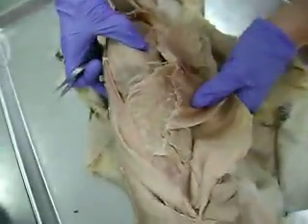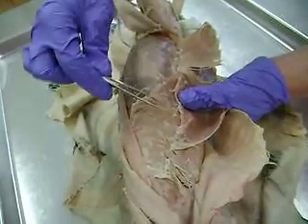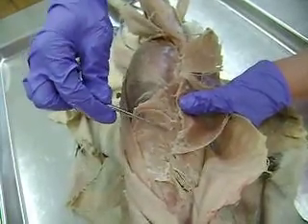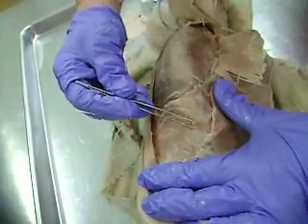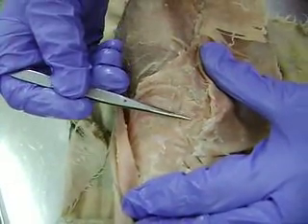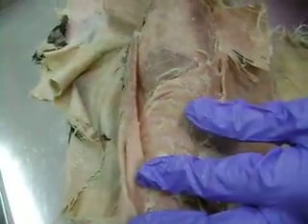I'm going to see if they have their intercostals separated out, but here you can see the ribs, and in between the ribs are two layers of muscles. There's an outermost layer called the external intercostals. I just want to try to pull away this top layer of muscle — that would be the external intercostals — and then the layer underneath it would be the internal intercostals. And that's it in the abdomen.